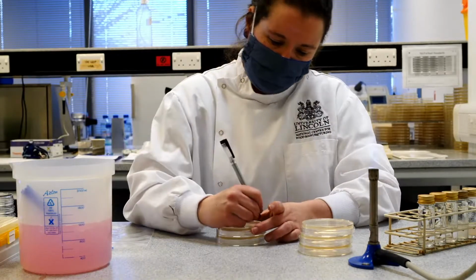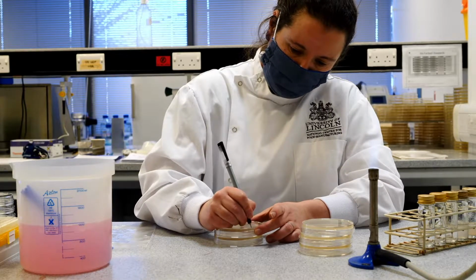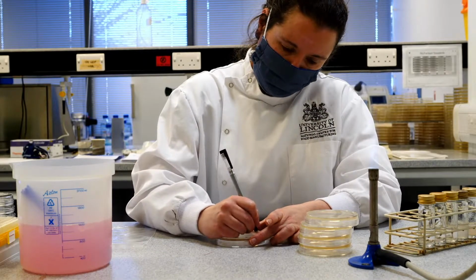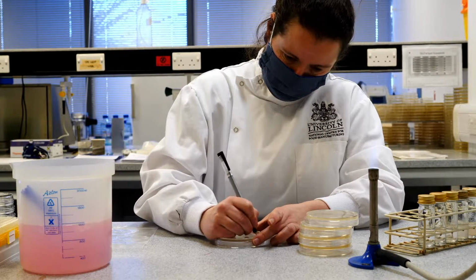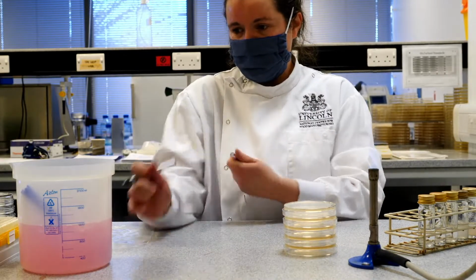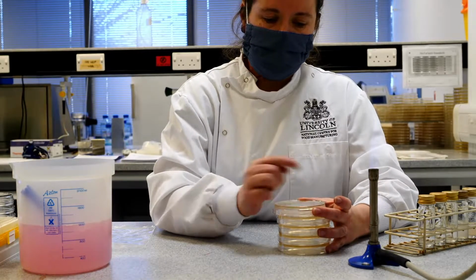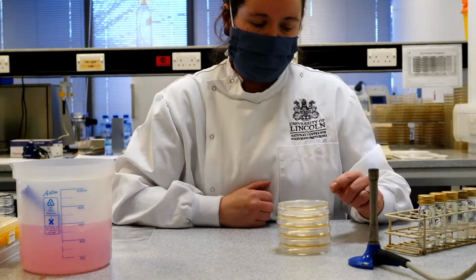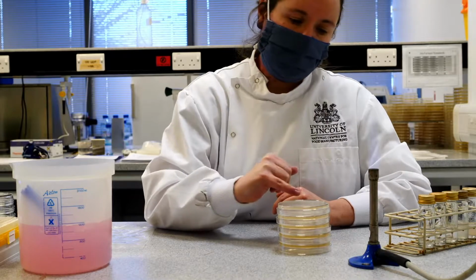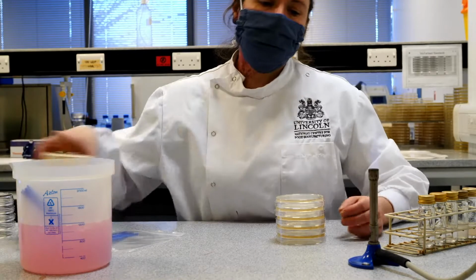Ten to the minus 3. To the minus 4. And finally to the minus 5. Now what you'll notice as I did that was I wrote as small as I could and as close to the edge of the plate as I could, because then by doing this, when I see bacteria growing on the surface of the plate, they won't be obscured by lots of writing. At least that's what we hope.